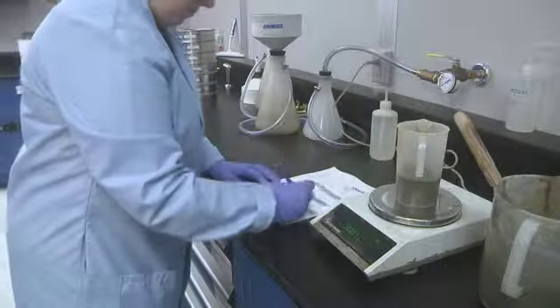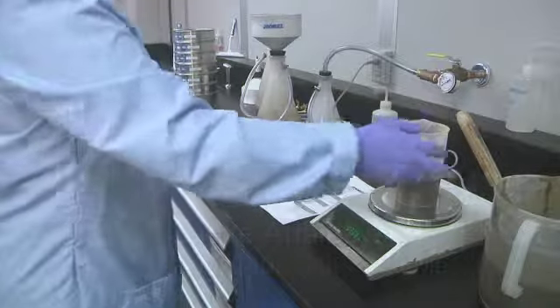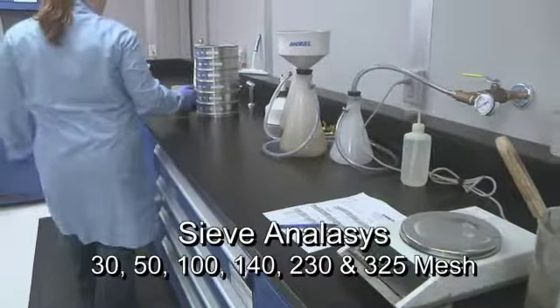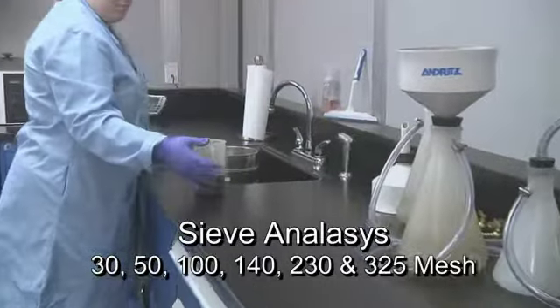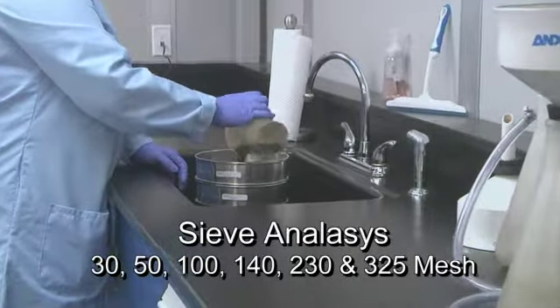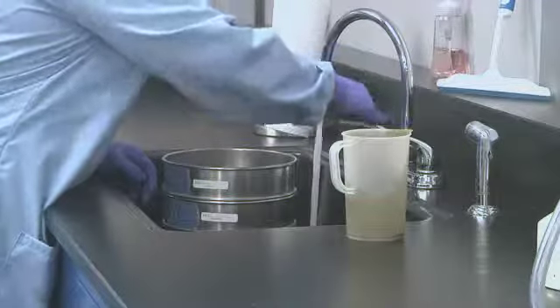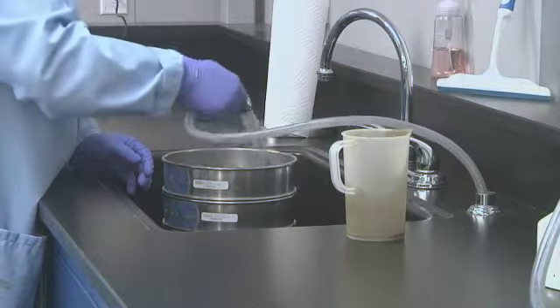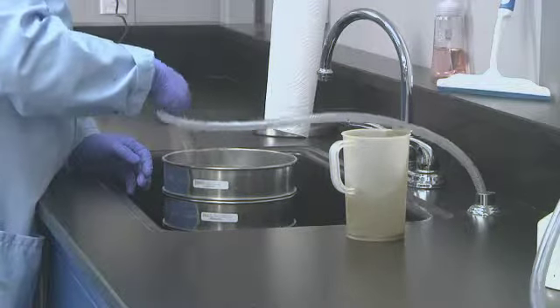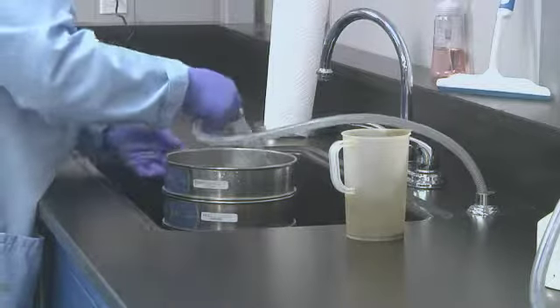A sieve analysis starts by weighing a portion of the test sample. Stack 30, 50, 100, 140, 230, and 325 mesh sieves in order. Wash the pre-weighed sludge sample from the uppermost screen to the next screen according to the stacked order. Continue the process until all 6 screens have been thoroughly washed.